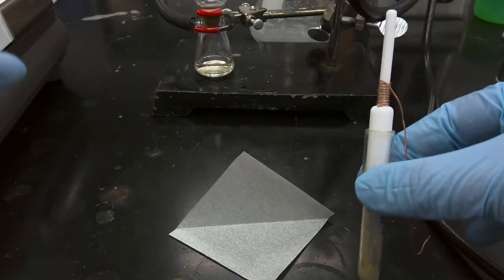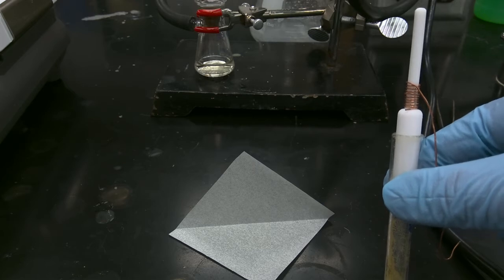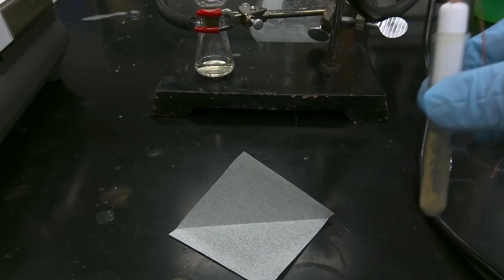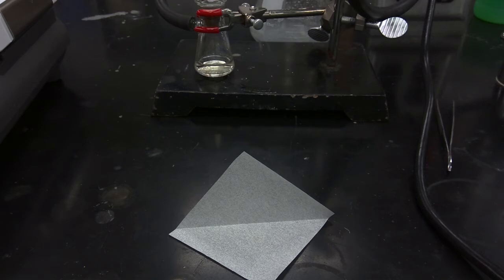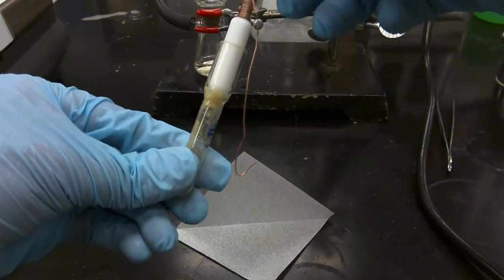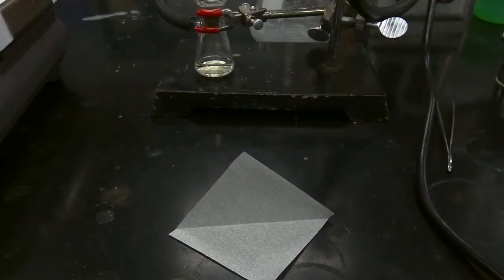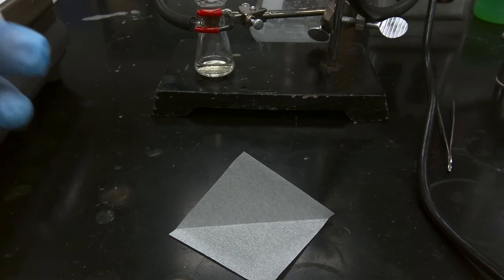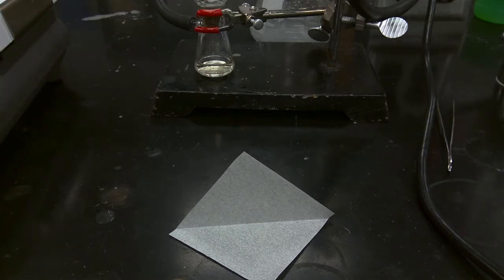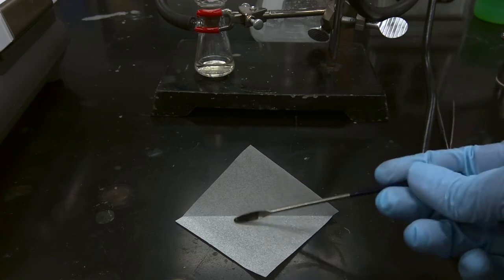Okay, so we have our Craig tube cap. We're going to collect our supernatant liquid off to the side, just to save in the event that we have an issue with the identity and purity of our product. So now we're going to very carefully transfer our solid product onto a pre-tared and pre-weighed piece of weigh paper.